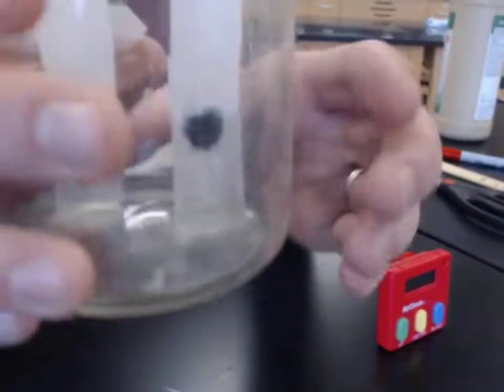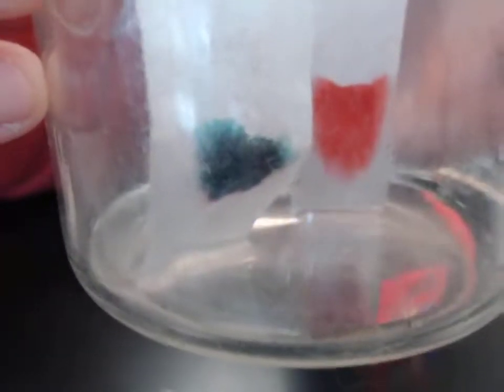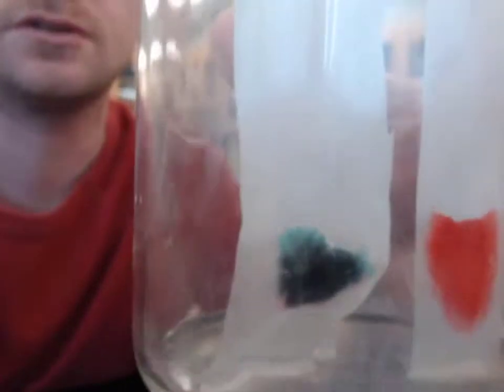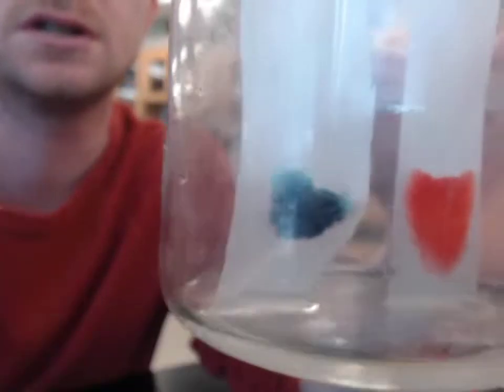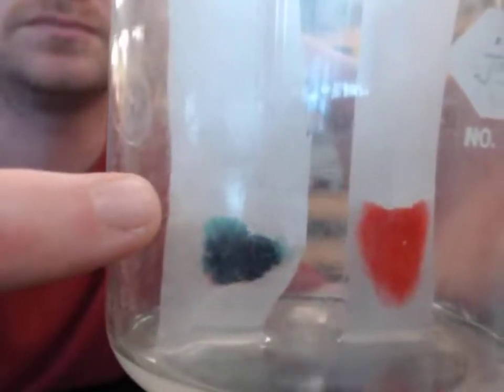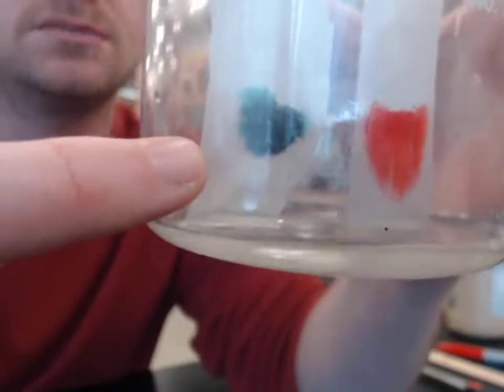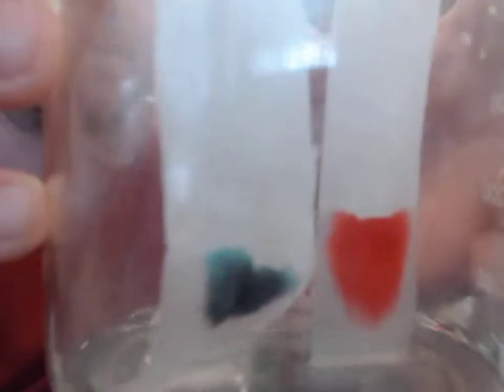It's a little more difficult to see in the camera. We'll turn them around. You see what's happening to that black dot now? Now the isopropyl alcohol is almost all the way through our black dot. It's bent a little bit there in the camera. But it's turquoise-ish colored now at the top. The bottom more purplish or maybe red.